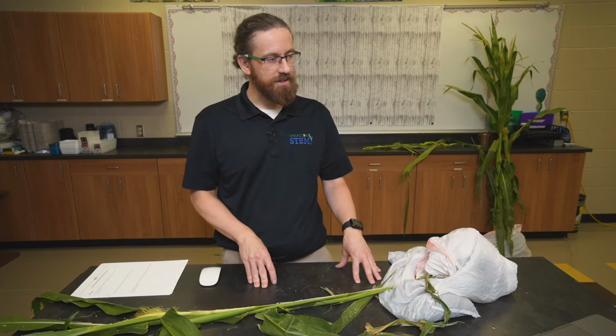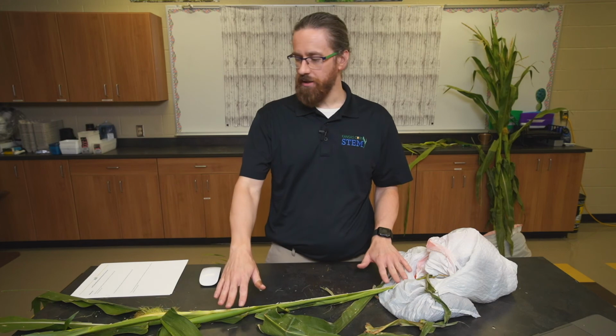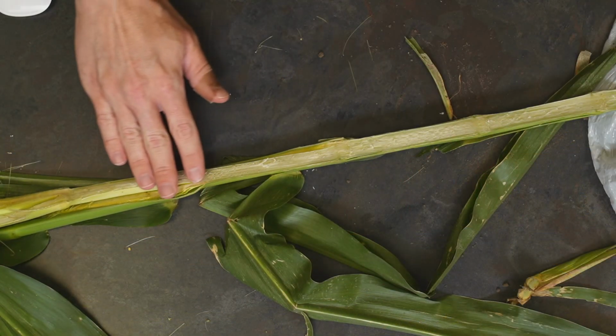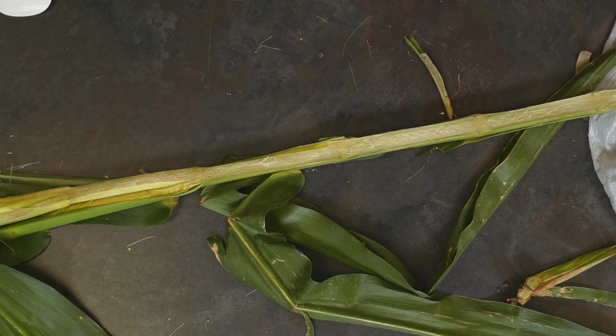All right, so we're here continuing lesson 3 on the Explore Corn Lab, in which we're looking at the leaf collar method for determining the growth stages of corn. You can see the corn plant right here in front of me. It has already been cut right down the middle, from the top of the plant down to the base of the plant.